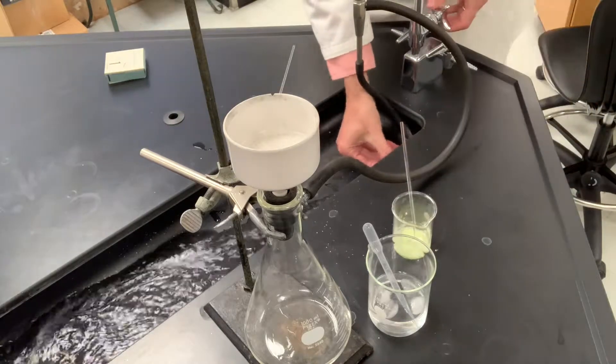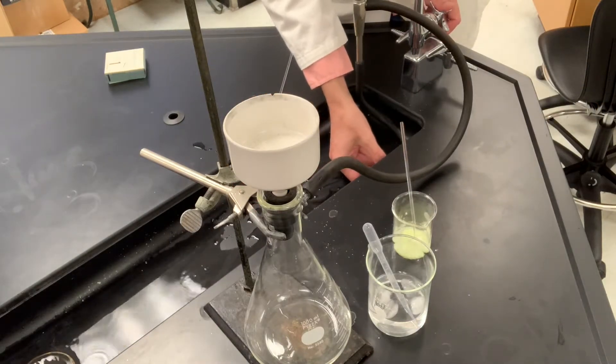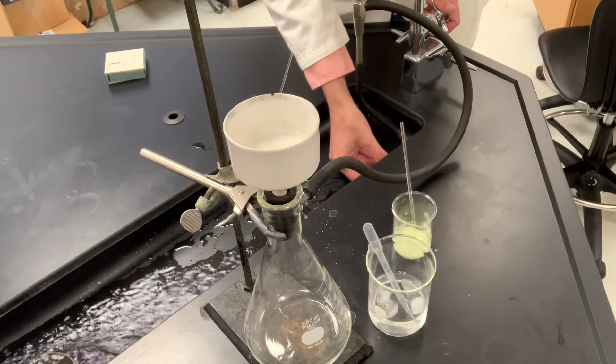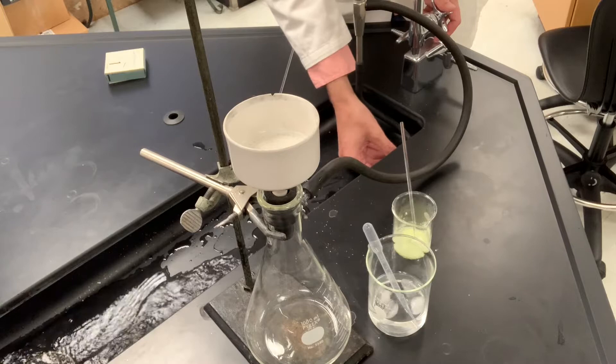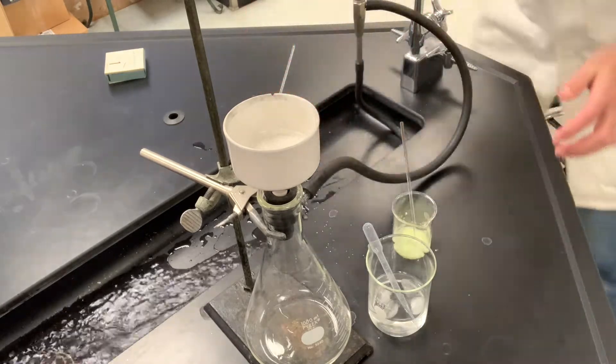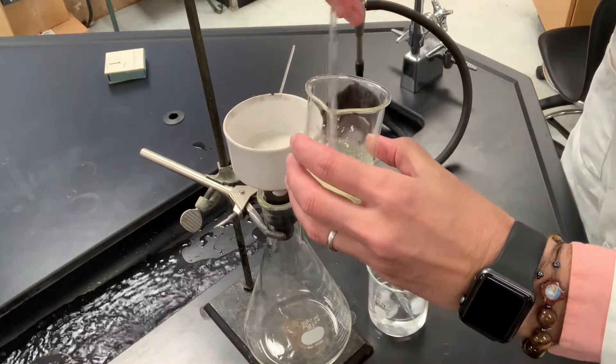I don't have the usual helper to hold this tubing for me, so let me see if I can position this. Okay, I think that's stable, so let's go ahead and filter this now.